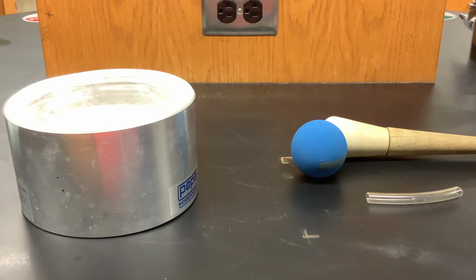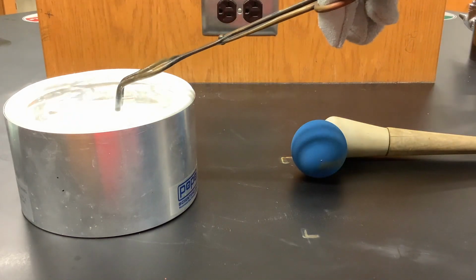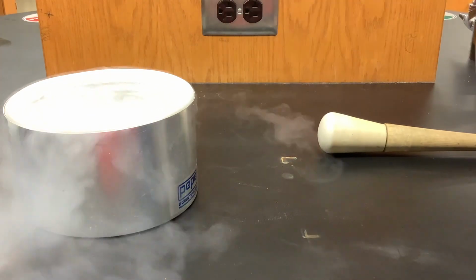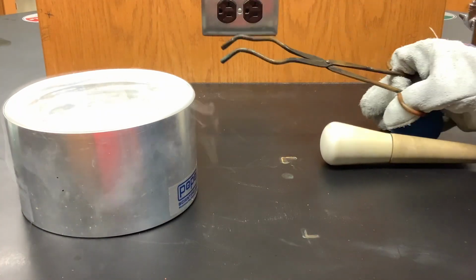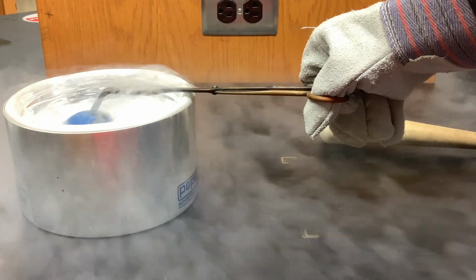In this experiment, we're going to see what would happen if we put something organic, meaning something like my finger, inside of liquid nitrogen. So in place of my finger, I'm going to be using this Tygon tubing. It's a rubber type of tubing. I'm going to insert that in the liquid nitrogen and let it cool thoroughly. I'm also going to take this rubber racquetball, which is very bouncy, and we're going to insert that in the liquid nitrogen. I want to make sure each of these gets cold enough so that they are the same temperature as the liquid nitrogen.